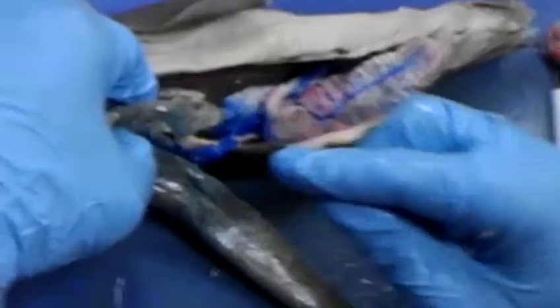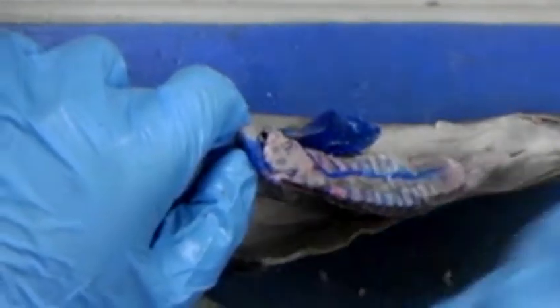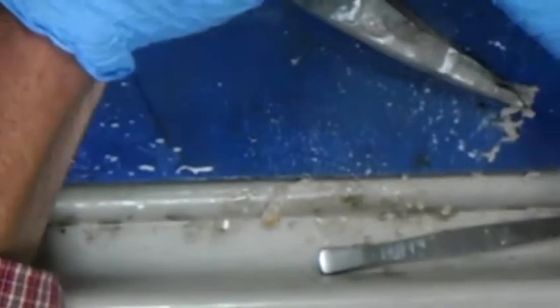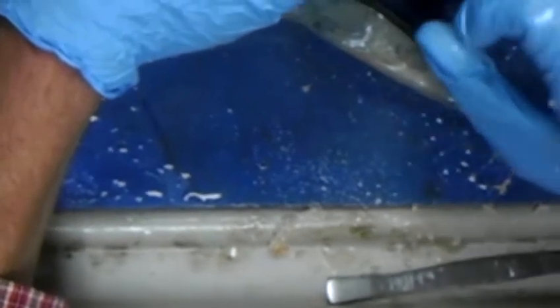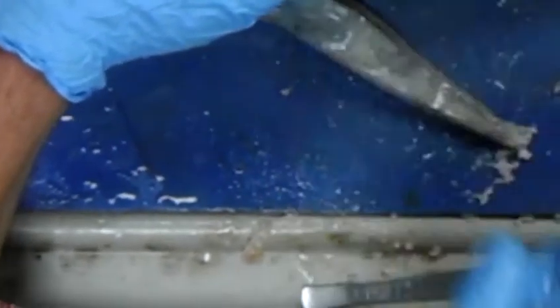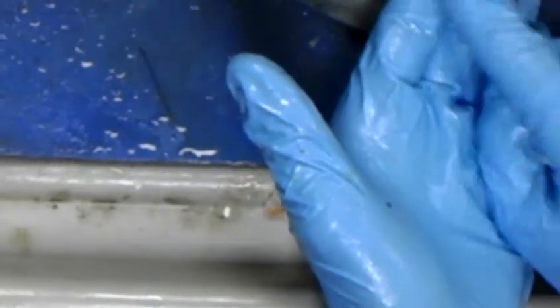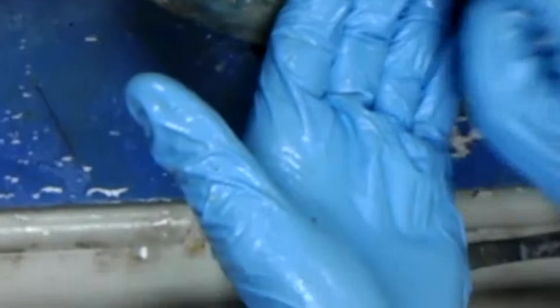The liver produces bile, it goes into the gallbladder, and from there it's secreted right here at the pyloric sphincter region. So bile is essentially a detergent that helps to break food items apart so it allows for absorption. So it does aid. Pyloric ceca that we find in like the largemouth bass act the same way. They're enzymes, little blind sacs located here that help out with digestion. Another structure that helps out with digestion is the pancreas. Organ form in the sharks, tissue form in the bony fishes. So you cannot point out the pancreas in the bony fishes. It's there, but it's diffuse.